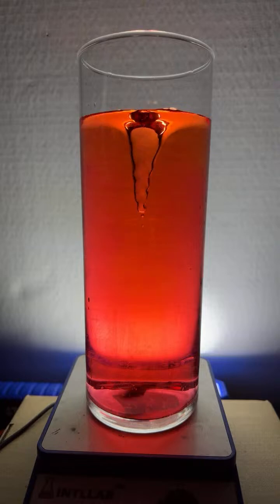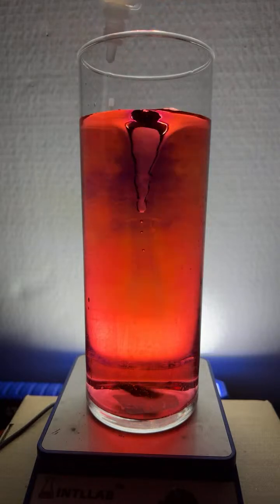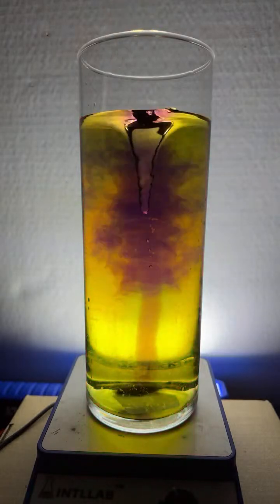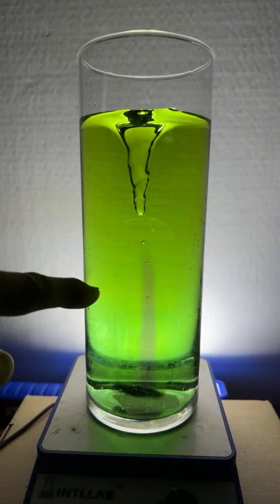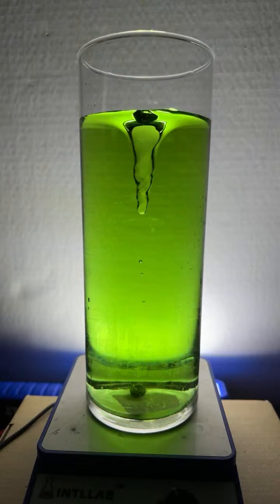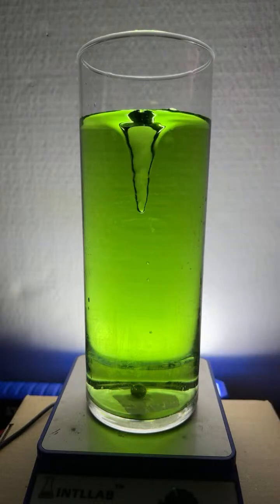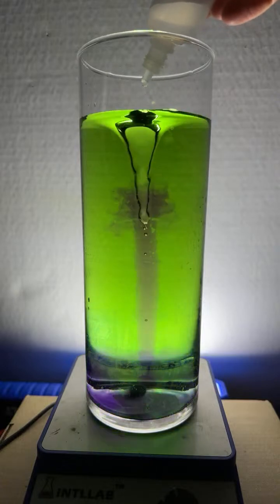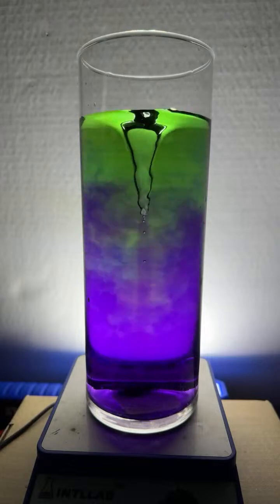What if you use soda? It'd be interesting to try. I do a lot of experiments with soda. Now I'm adding base. So, I'm Dead channel, you're saying I should do this and then do it with soda water and see what happens. I do some experiments with that. When you add the universal indicator to soda water, it turns red because the soda is indeed acidic. But it would be interesting just to try it. Thank you there, Lullaby. That's a great idea, I'm Dead.